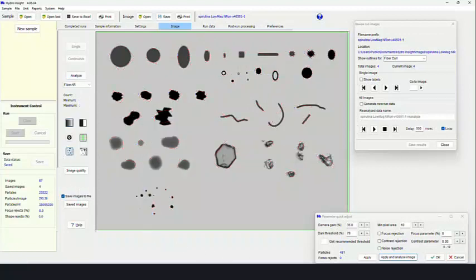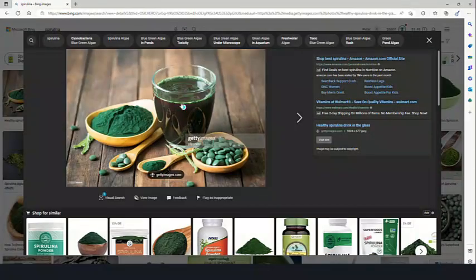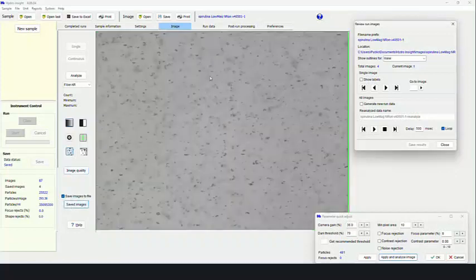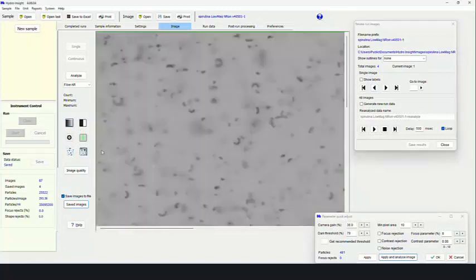So spirulina, if I open up here, it's a dietary supplement, basically. But when you actually look at the zoomed in images of spirulina, you could tell they're a bit curved. I could actually zoom in a little bit and show you what it's like, and you'll see some that are actually very curved. When you see the curved images, again, they're very small. We can actually, let's do an actual fiber curl in this case.